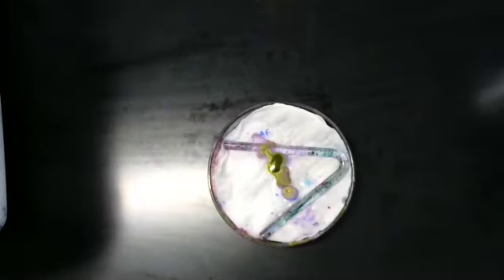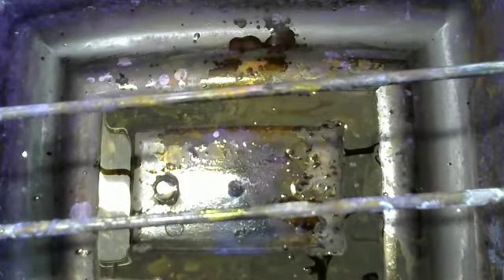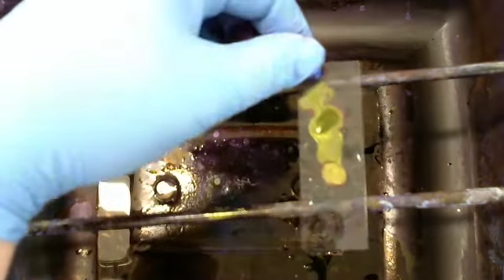And here we are back with our acid-fast stain. We're going to shift this out of the way and shift back in our staining rack. Put our slide right here. And we're going to take our DI water, and we are going to rinse the slide.